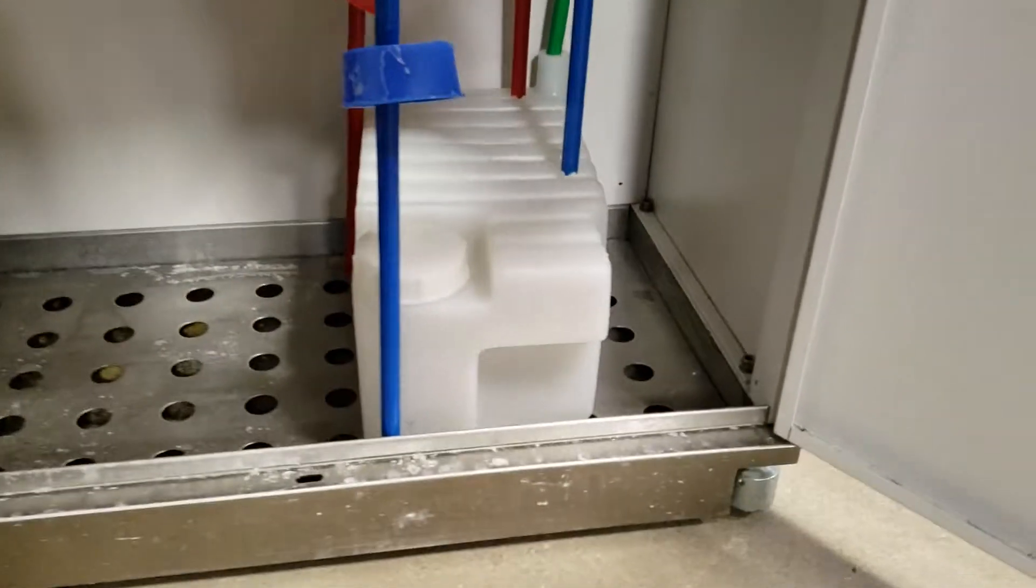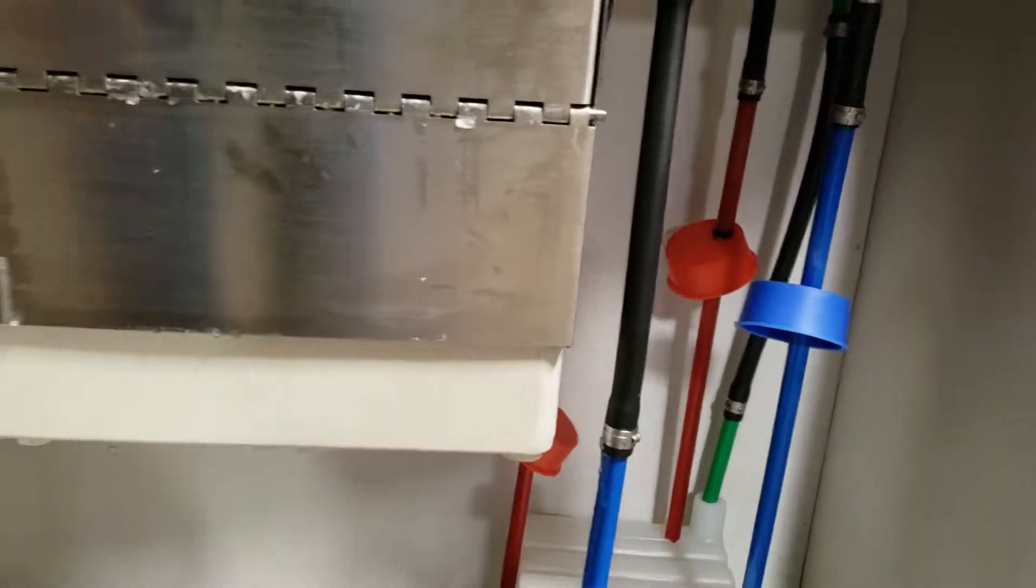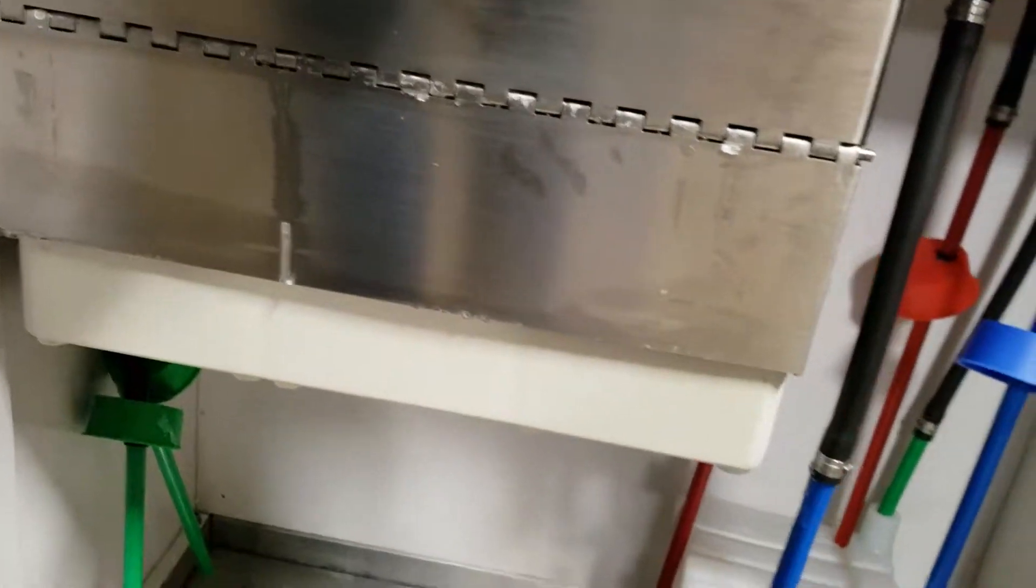Here is the reaction chamber. Looks like you need to undo that to open it.